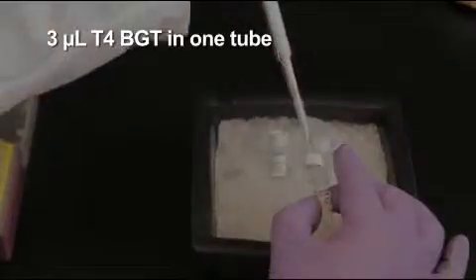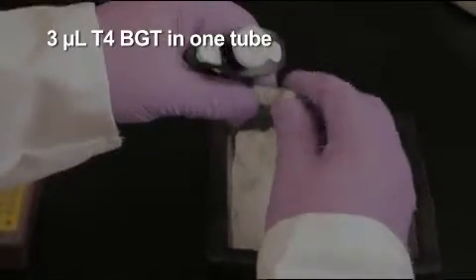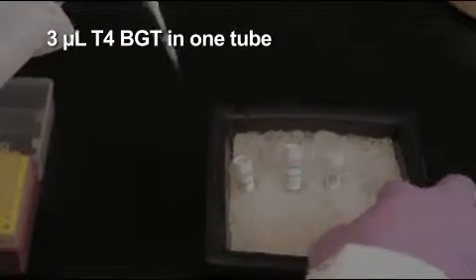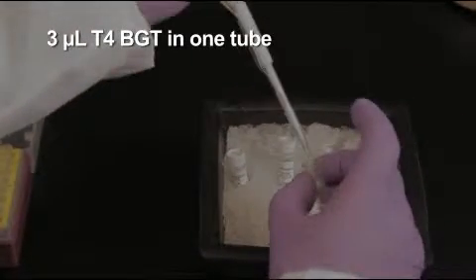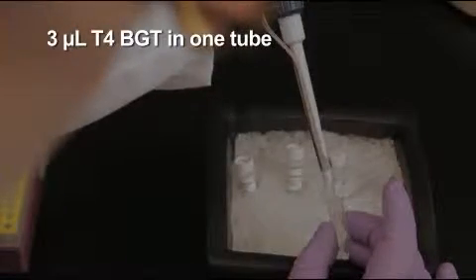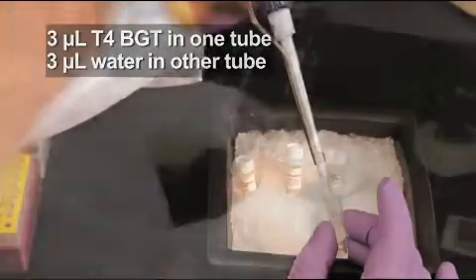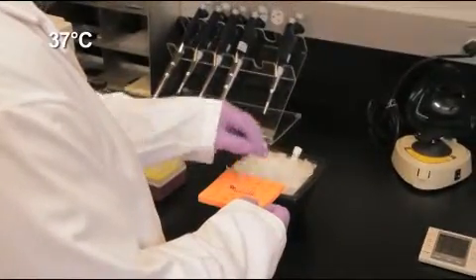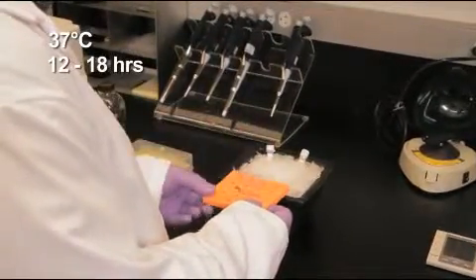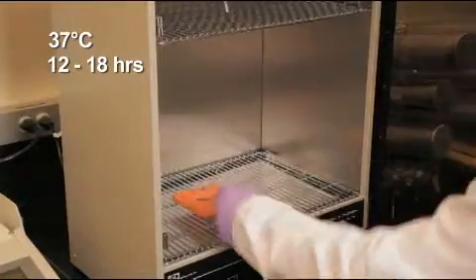Then add 30 units or 3 microliters of T4 beta-glucosyltransferase to one tube. Mix well by gently pipetting up and down. Do not add the T4 BGT to the second tube as it is the control reaction, but be sure to add 3 microliters of water. Incubate both tubes at 37 degrees Celsius for 12 to 18 hours, during which time the BGT will add glucose to the hydroxyl group of 5-hydroxymethylcytosine groups in the sample.